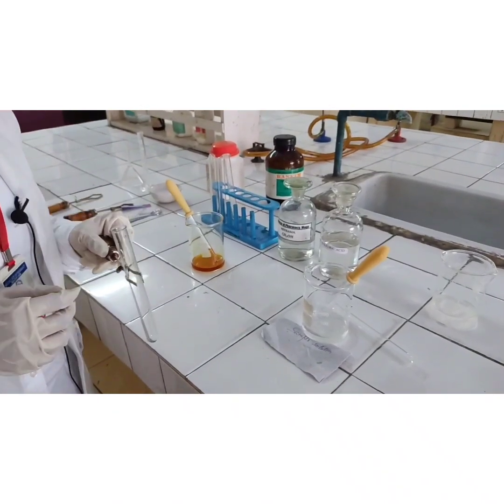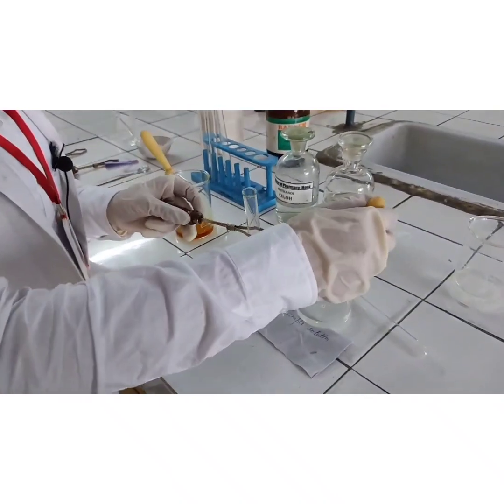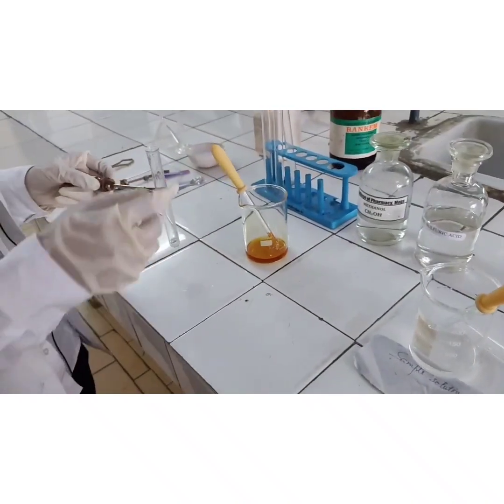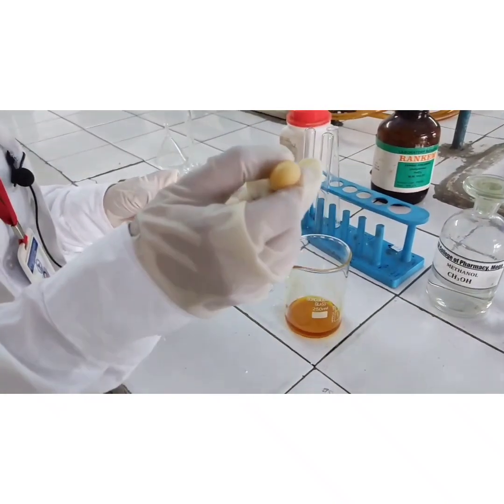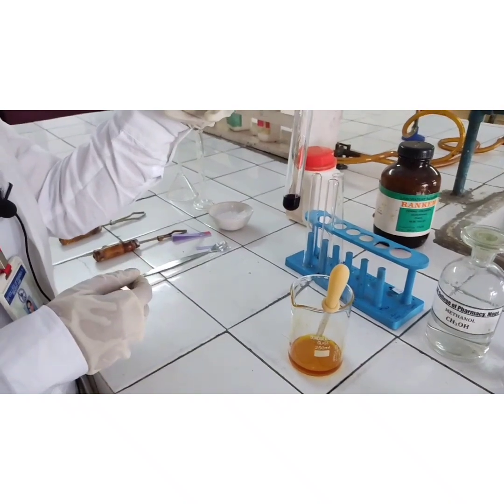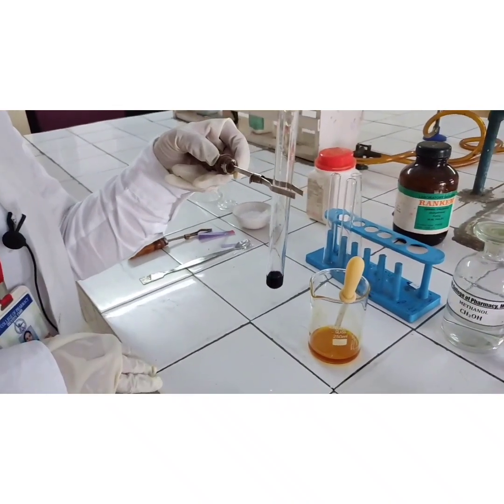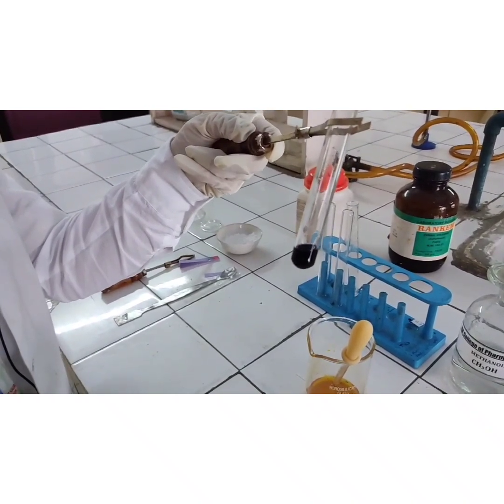To confirm our organic compound, we will perform a further test. We take the sample solution in a test tube and add 1 or 2 drops of ferric chloride solution. A violet color is formed, which gives us an indication that our compound may be salicylic acid. This violet color is due to the formation of a ferric salicylate complex.